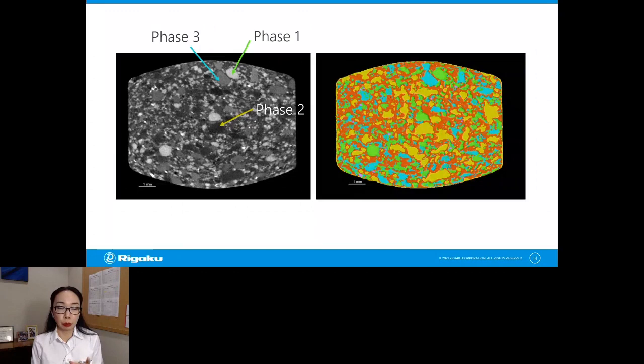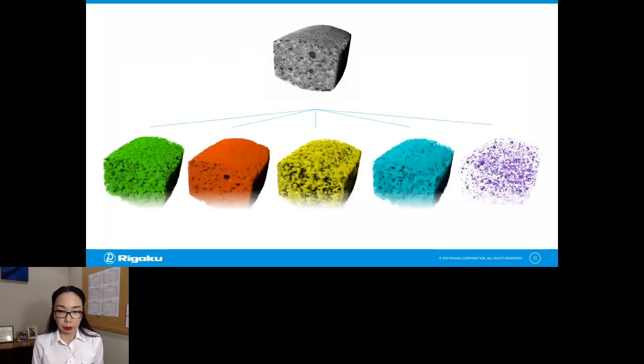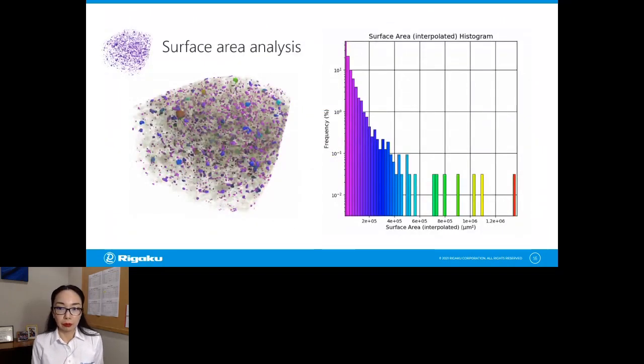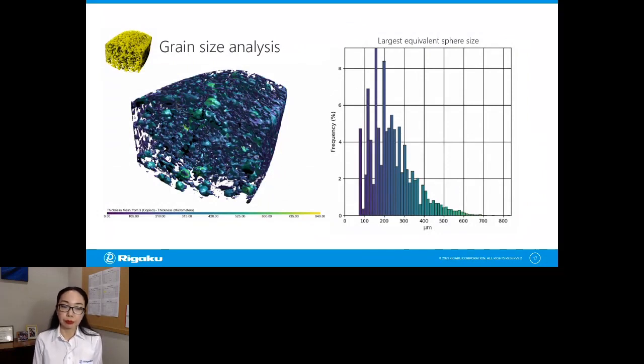And this segmentation of the original image is the very first step you always take if you're going to quantify something with CT scan. Now, this is just a 2D cross section, but you, of course, do this in 3D like this. And at this point, you can calculate the volume percentage of each phase. And you might be interested in analyzing something like surface area of small particles. So in this view, one phase was selected, and the surface area distribution is shown in the histogram. You can see that most of them are small, and purple in this case, but you see green or red particles with a larger surface area here and there, and you know their locations too. Or you might want to know grain size of a different phase, and you can do it in the same way too. So this is how you go about analyzing CT data.